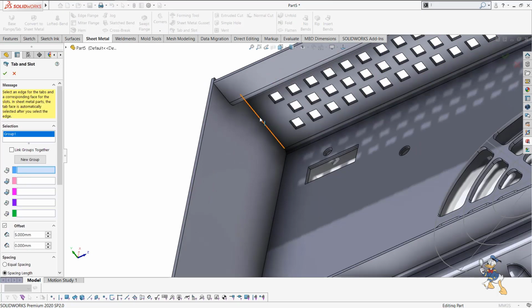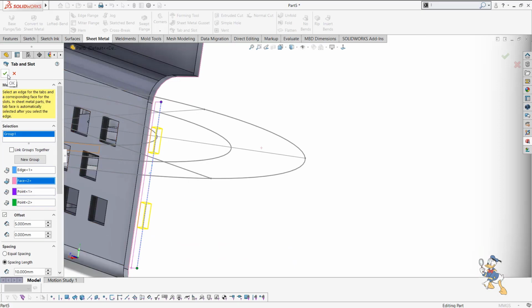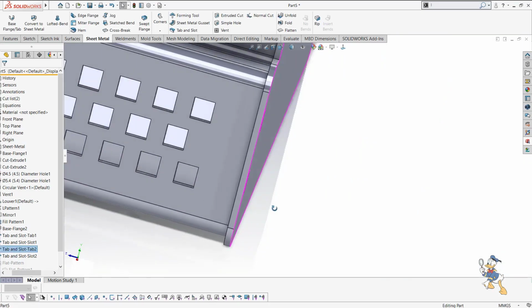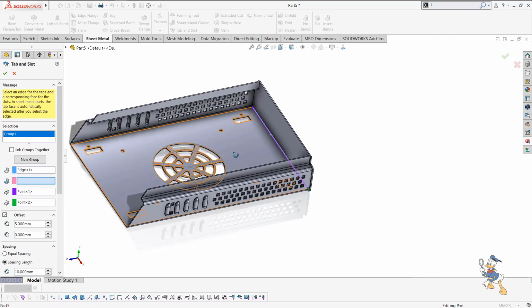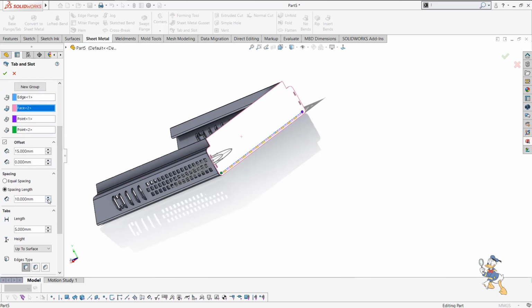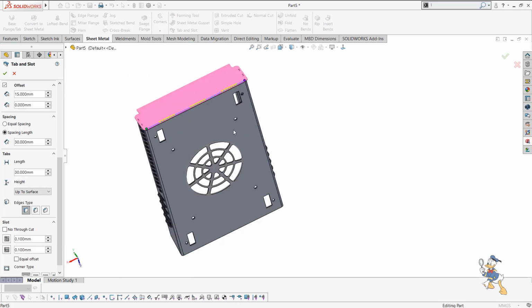Over here I just need to generate tab slots as well. I just need to select the line, the face, and by enhancing previous features I just need to check it out over here only, and it automatically generates tabs and slots here. I just need to generate some tab slots over here as well, so I just need to check it out over here. I just need to select the edge, the face, and suppose I need an offset value of 15, total distance 30, or I just need to generate like 3 tabs and slots over here.